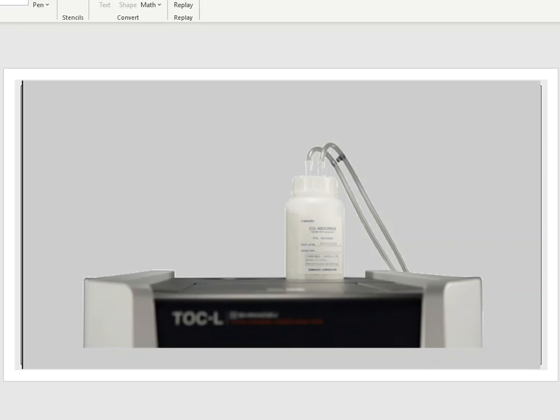Exchanging the bottle is very easy. You normally do not unscrew the cap here. The entire bottle gets replaced. So the tubing lines at the top will be disconnected from the bottle, and then this entire thing will be trashed and you will order a new one.